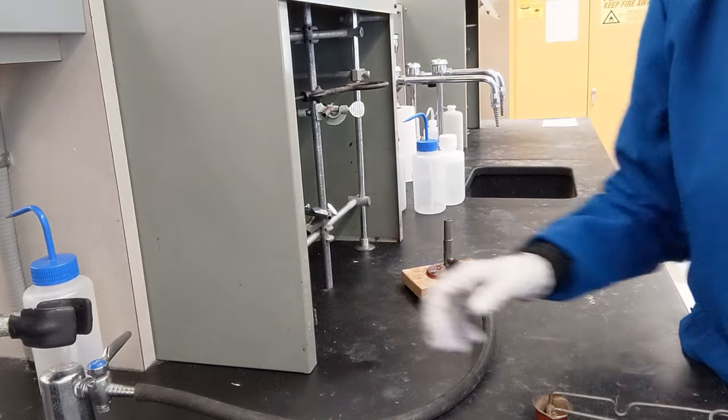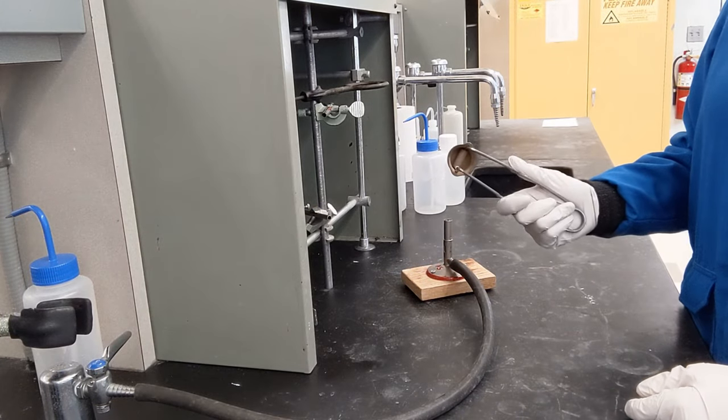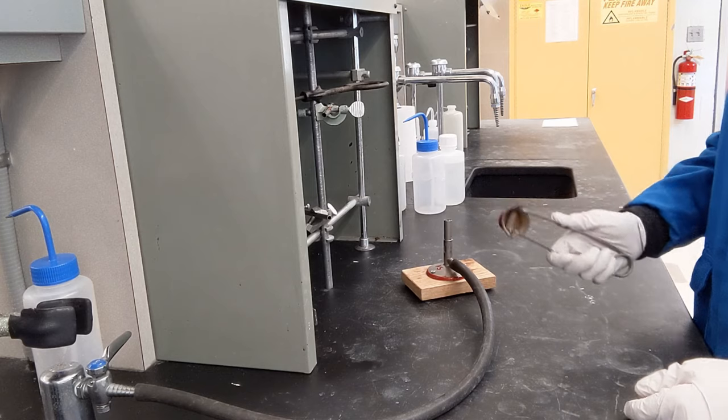You need a gas line, a hose that's free of cracks, and you need to have some ignition source. This is a striker.